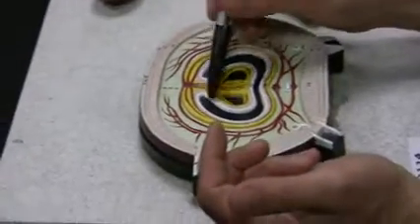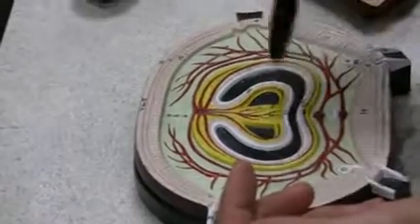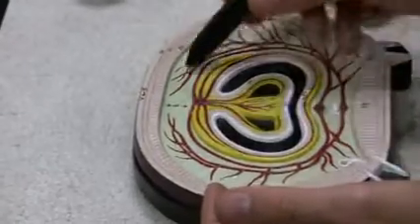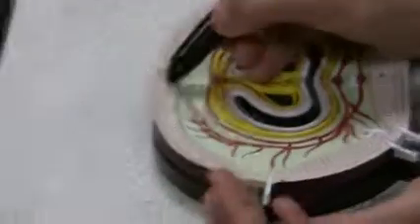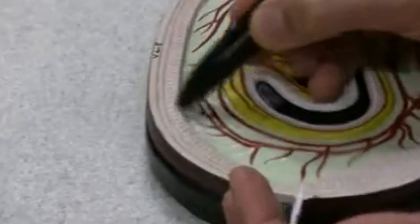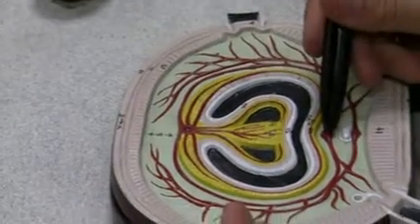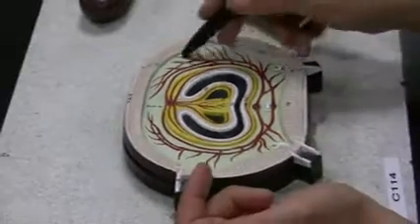But anyhow, this is typhlosole. This is lumen of the intestine. These are epithelial cells of the intestine. Coelom. In the coelom, they draw you some blood vessels. Circular muscles, they go round. And then longitudinal muscles, those bands. Those are all longitudinal muscles. Okay? And then, of course, epidermis outside. Nerve, blood vessel. Is there anything else I should know? Coelom, of course. This is all coelom.